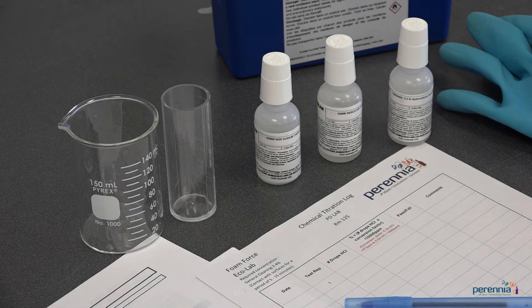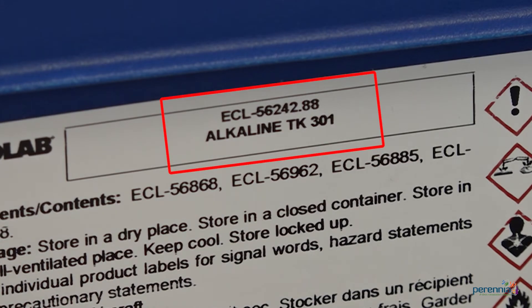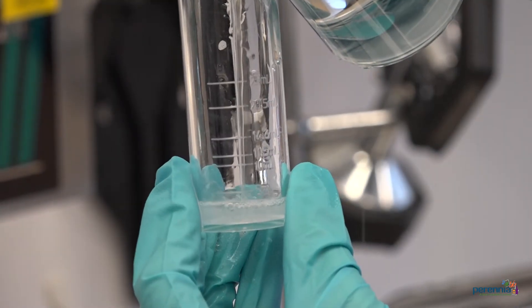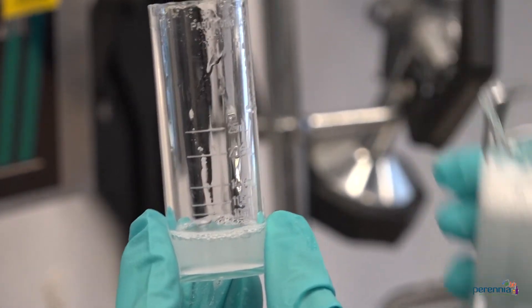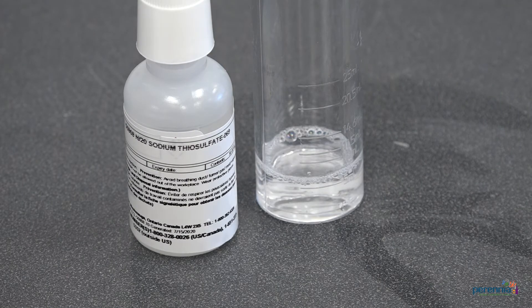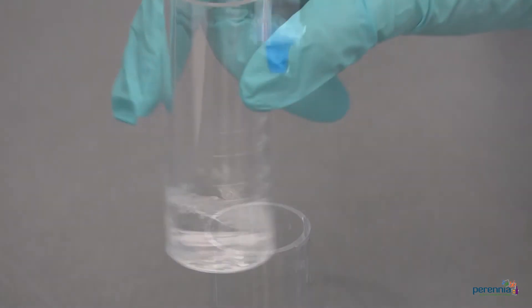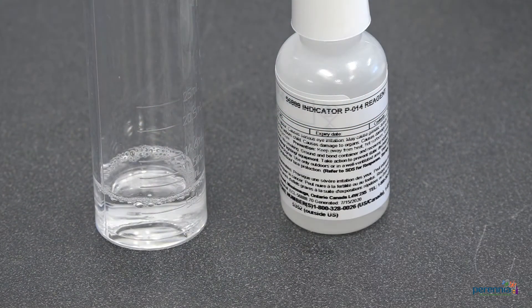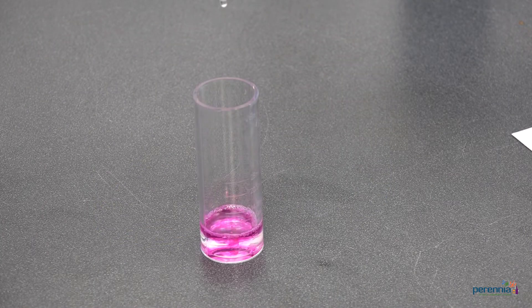To perform the concentration verification we use the following procedure. Step 1: use an alkaline test kit. Step 2: rinse and fill the vial to the 5 mL line with the solution to be tested. Ensure the solution is in its liquid form. Turn the air off when taking the sample if using a foam hose. Step 3: if the solution is chlorinated — in this case it is — add 10 drops of sodium thiosulfate, Normal 20 number 069. Swirl to mix. Step 4: add 5 drops of indicator P number 014. Swirl to mix. The solution will turn pink.